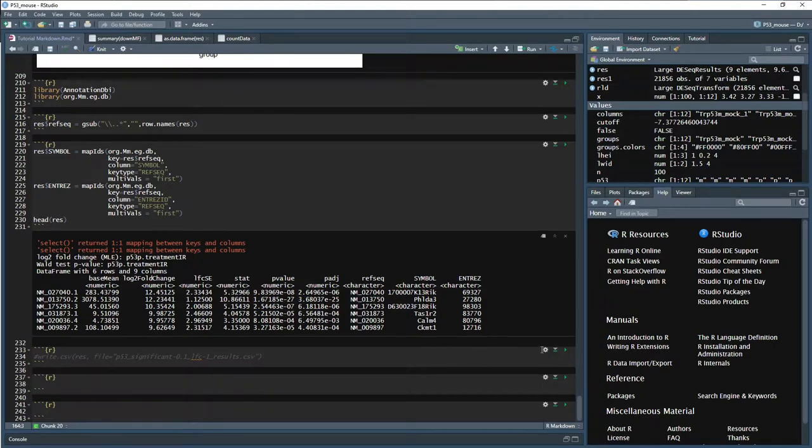Or you can click this arrow pointing into a green rectangle, and what that'll do is it'll run everything that's above the current cell. So if I click this one, it would run all of this and it wouldn't write the CSV. I commented this out just so I don't have that table being rewritten every single time.